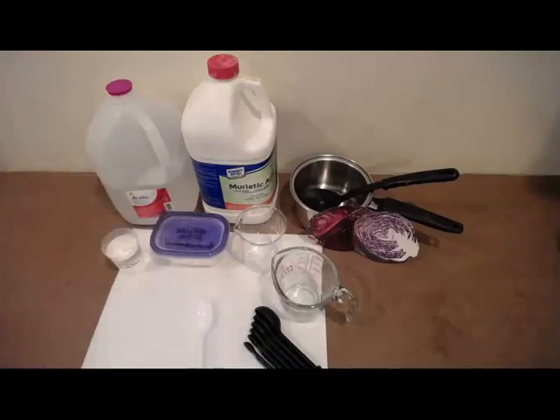So let's start by putting on our safety gear, putting on goggles and gloves, and then we're going to go ahead and get started with our procedure. Step 1 tells us we're going to make the same indicator solution that we made in experiment 13.2. And remember, we always want to start by rinsing anything that's going to come into contact with that indicator solution with our distilled water to get away any impurities that will be affecting the pH.